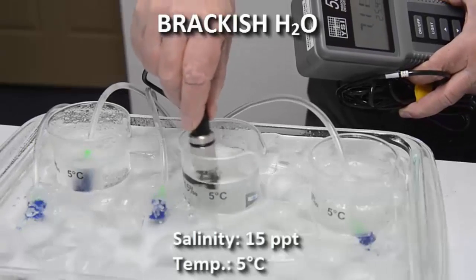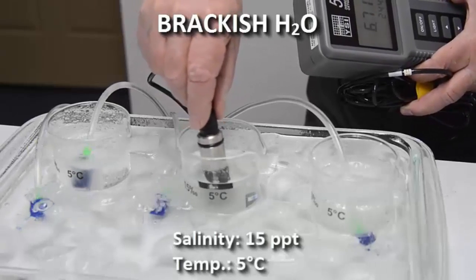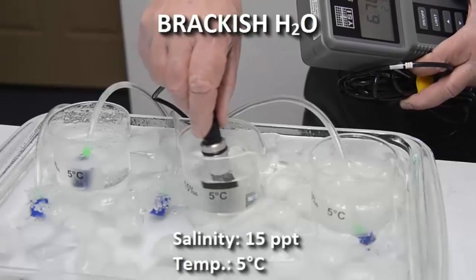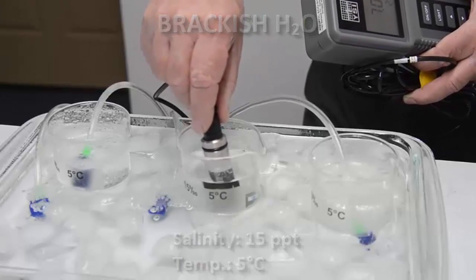So here we are, we're going to look at 15 parts per thousand salinity and cold water at 5 degrees centigrade. 11.2.